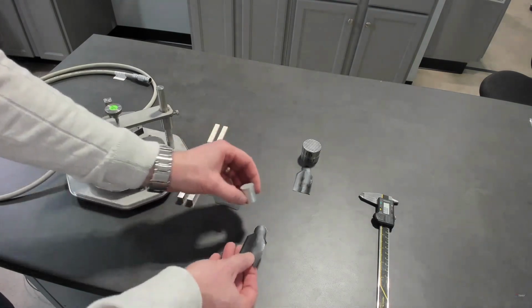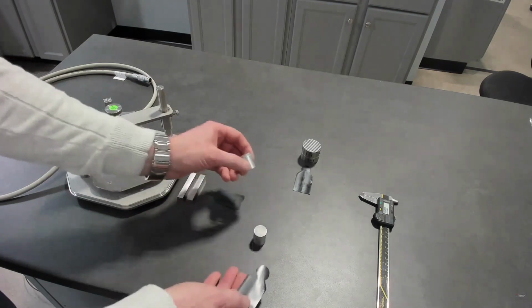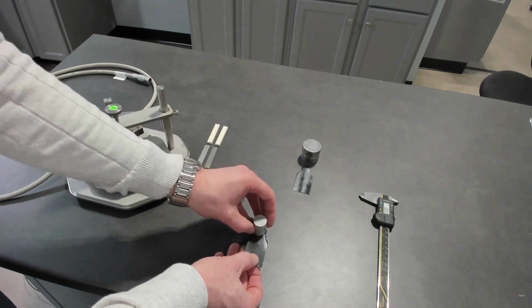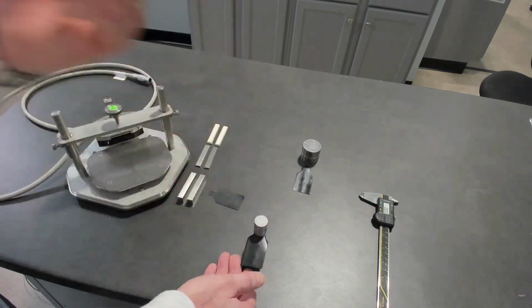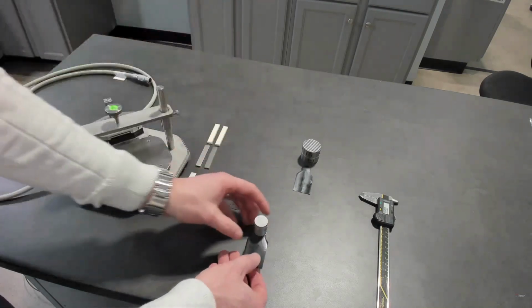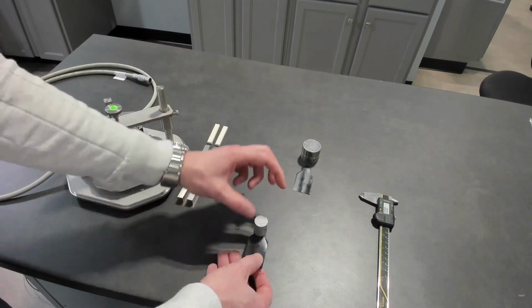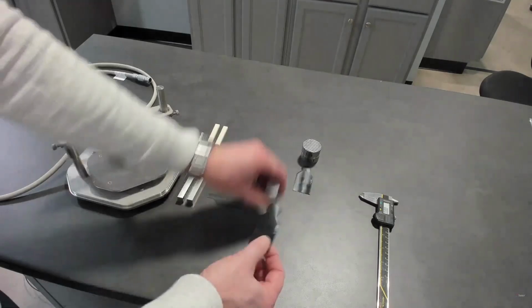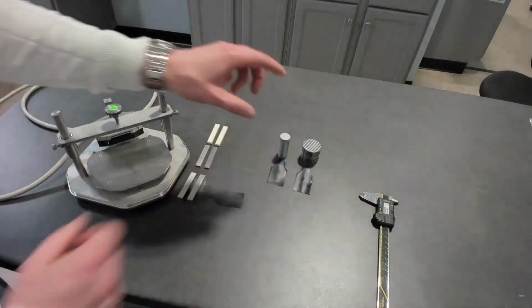In that case, whether it's symmetric or asymmetric, single-sided, you're measuring along the length of that elongated shape, a rod, whatever it might be. And of course, with different diameters of sample, we have different diameters of sensor. So that's transient plane source for the one-dimensional module.